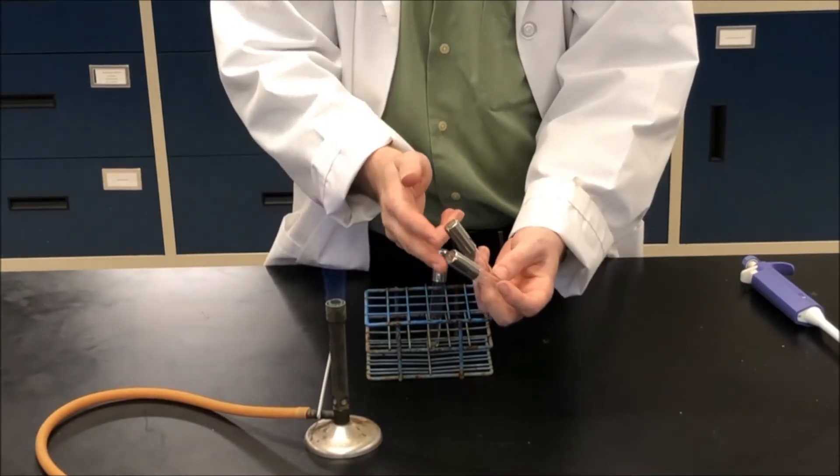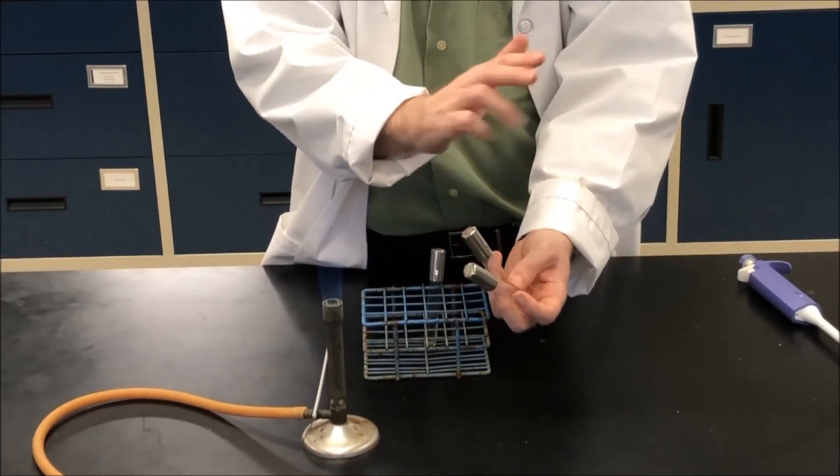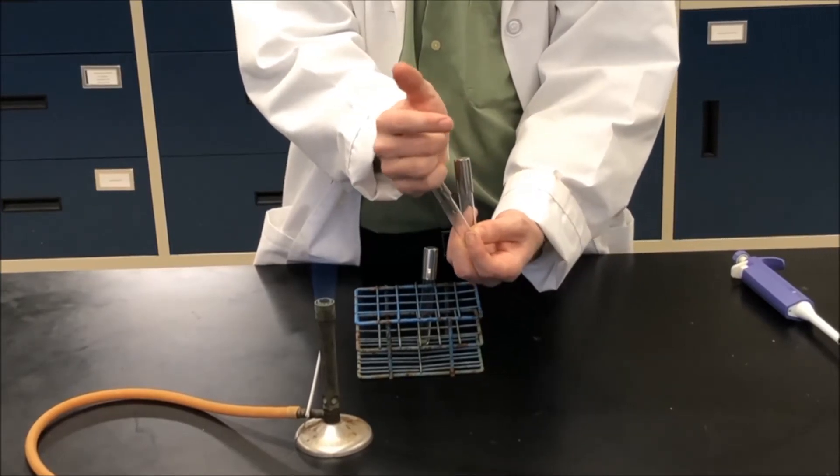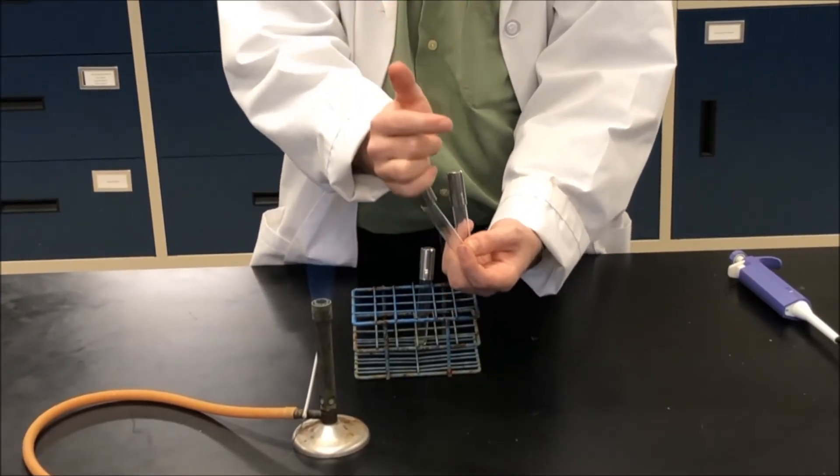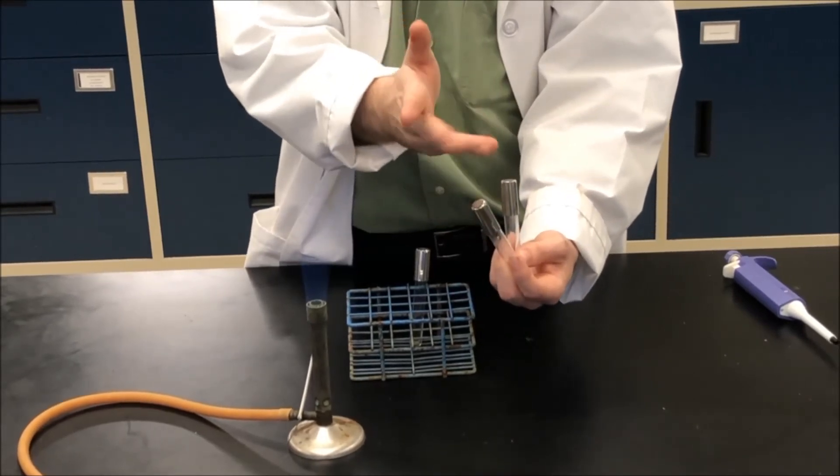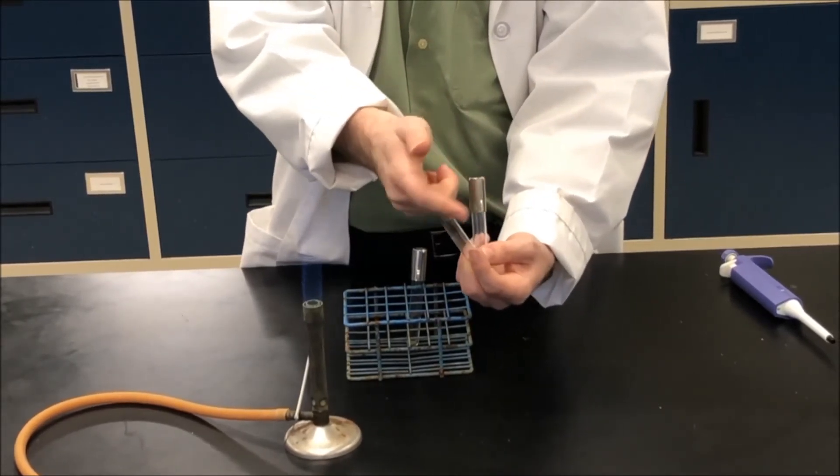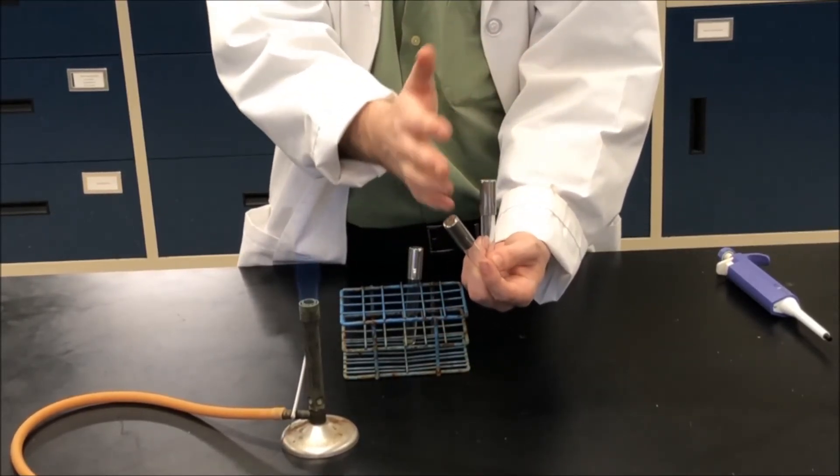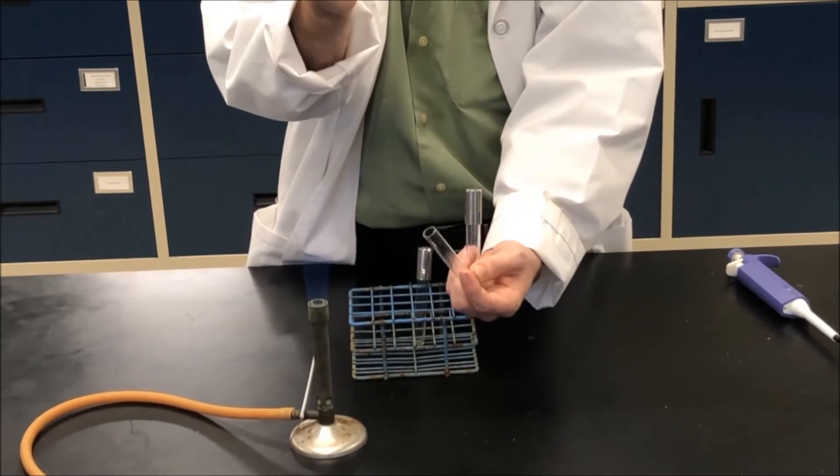Now the way I am opening these test tubes is with my pinky. I am grabbing the cap and opening like that. Some other people go this way between the last two digits of your hand as such. Basically, the easiest is just use your pinky and lift like that.